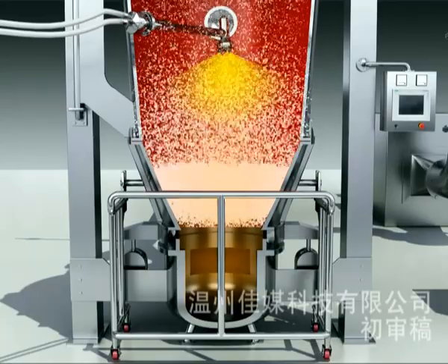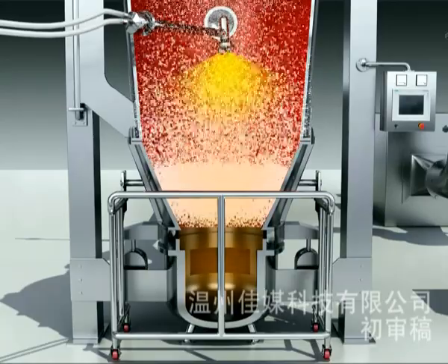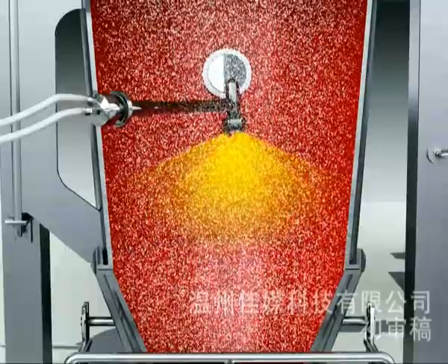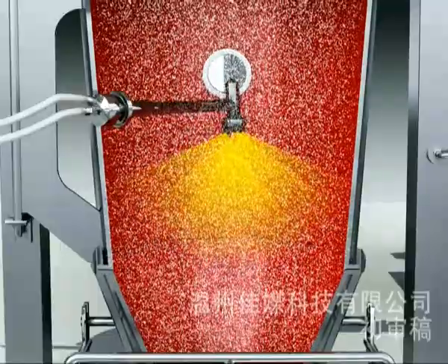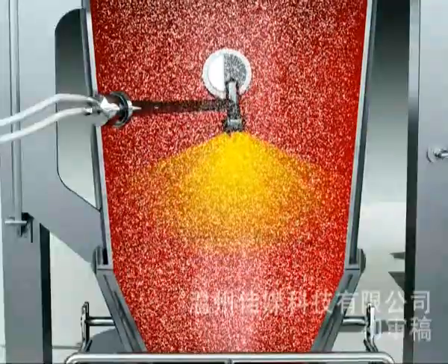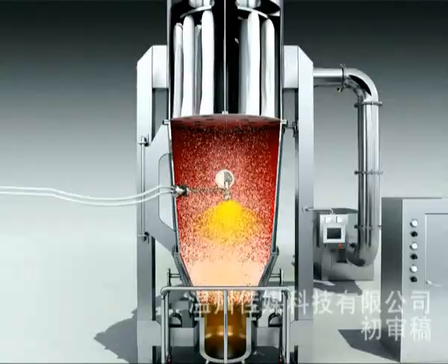The fluidized powder is brought up to the expansion chamber and passes through the spray nozzle, contacts the atomized mist sprayed from the spray gun by compressed air. The powder should accumulate together and form granules.